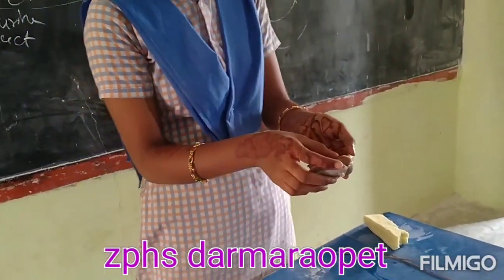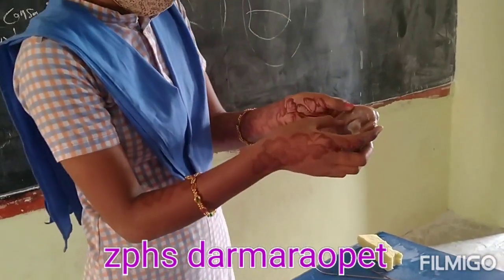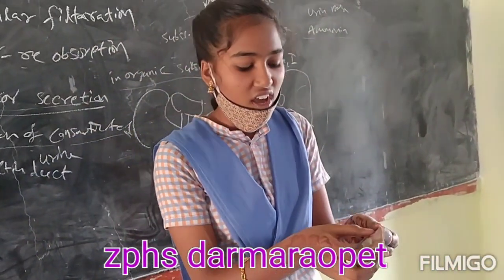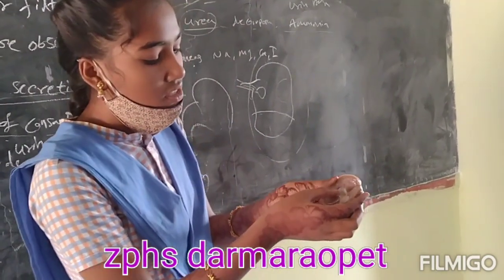The brown shape is cortex. Light brown is medulla. This is nephrons.